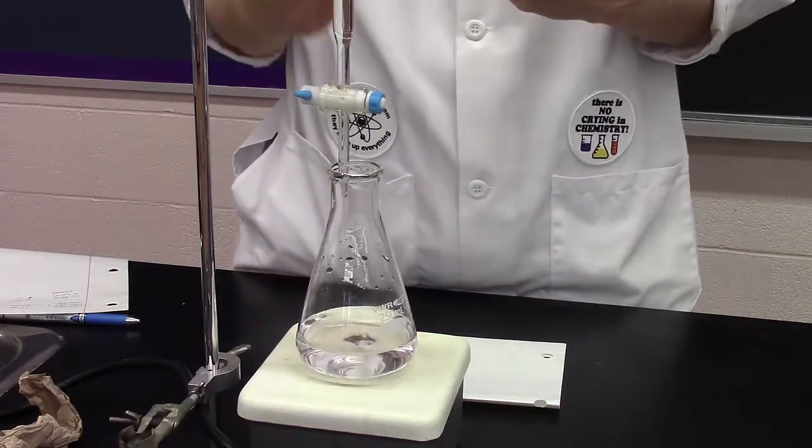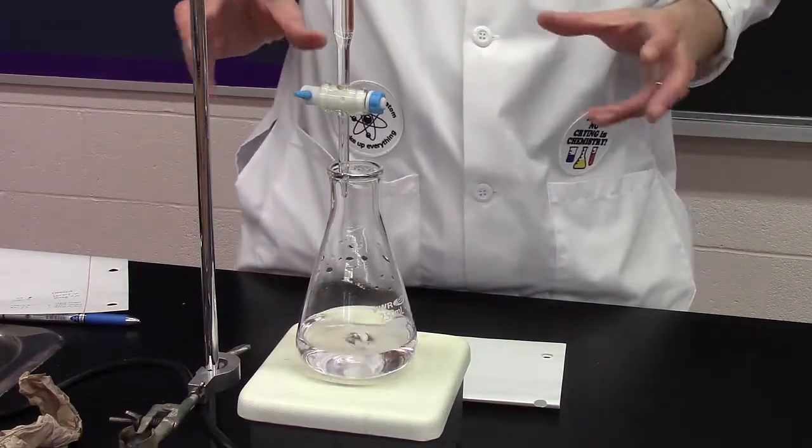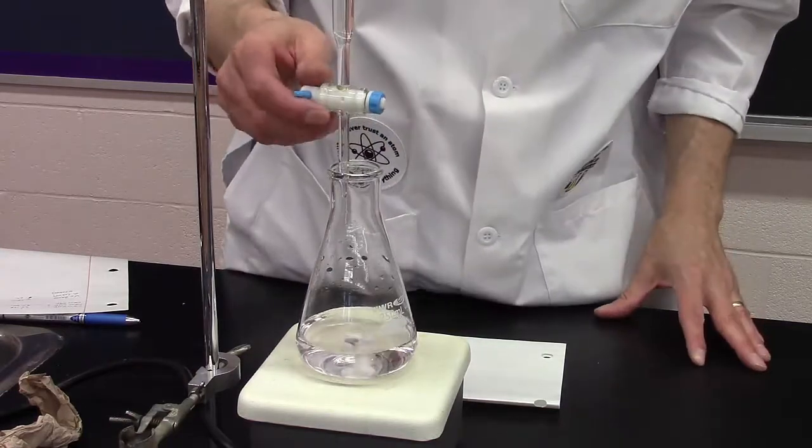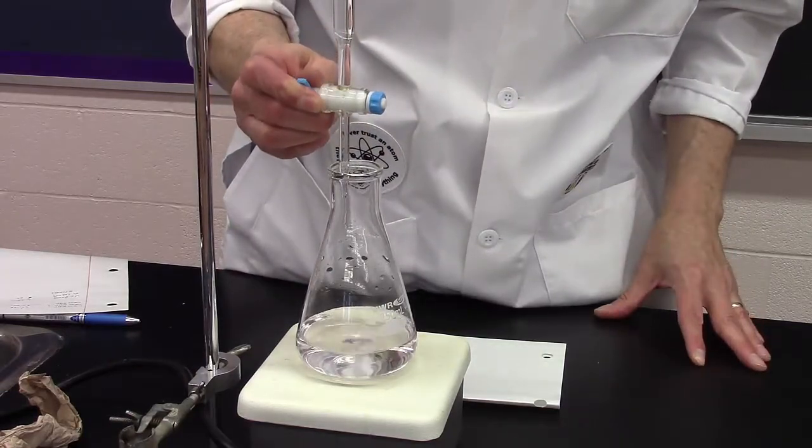I'm going to add just a single drop more - in fact, almost not quite a single drop because it's going to hang off and I'm going to try and tap it.